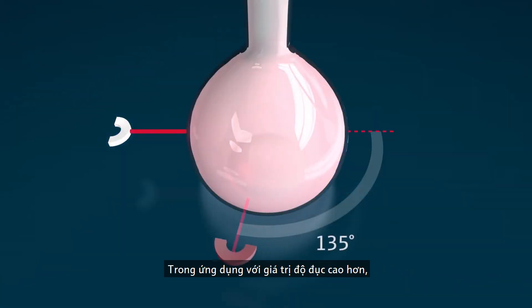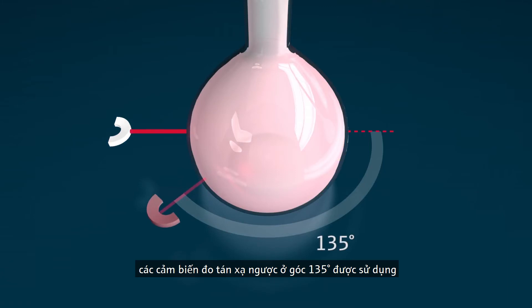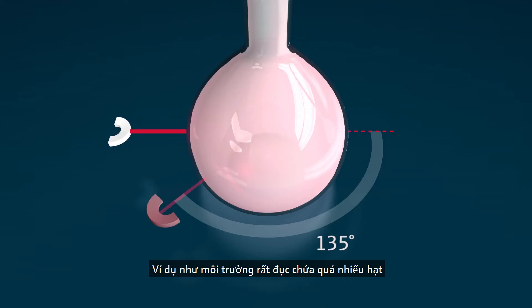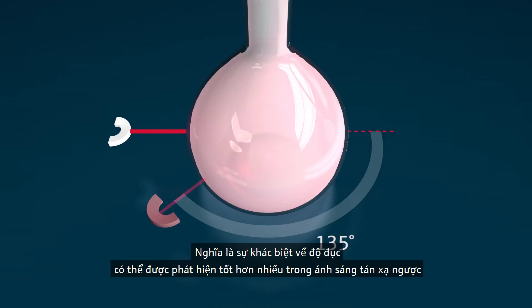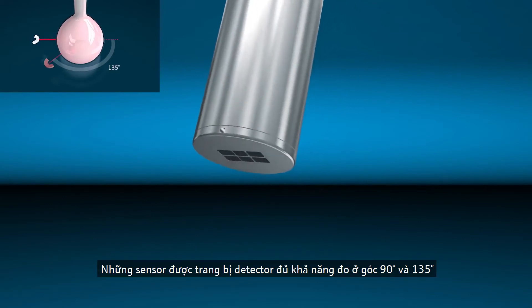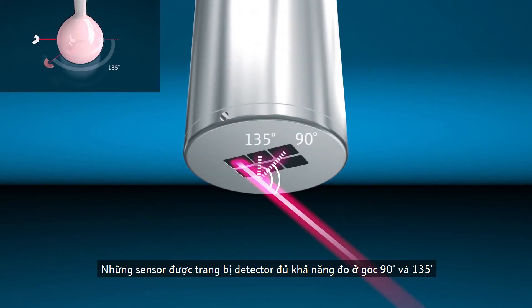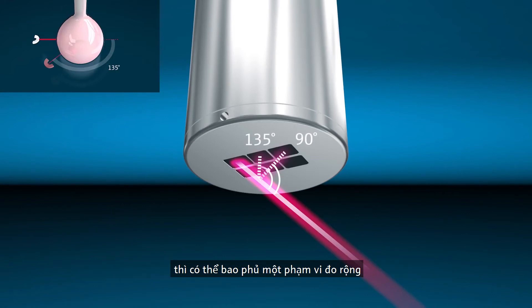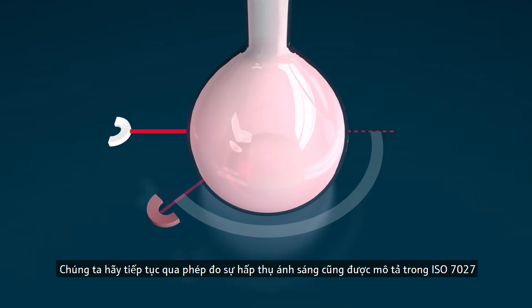In applications with higher turbidity values, sensors are used that measure back scattering at 135 degrees. Very turbid media contain so many particles that the main part of the light beam is back scattered, meaning differences in turbidity can be detected much better in the back-scattered light. Sensors equipped with four detectors measuring at 90 degrees and 135 degrees are able to cover a wide measuring range.